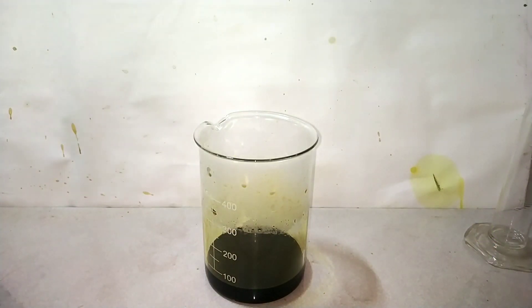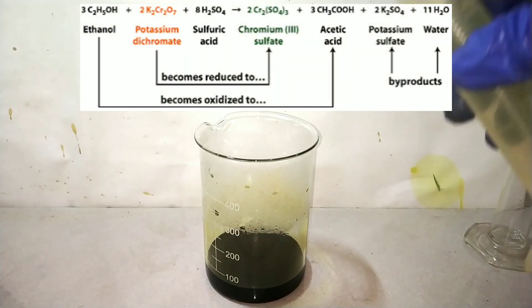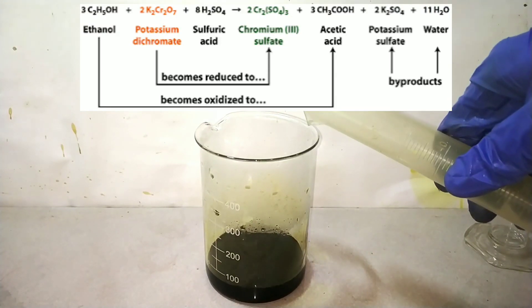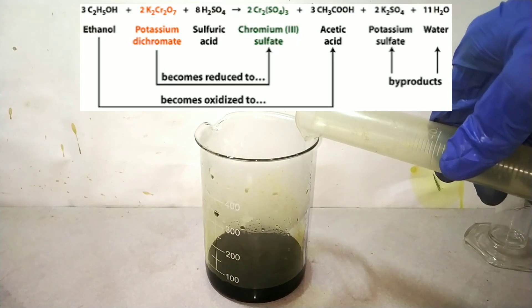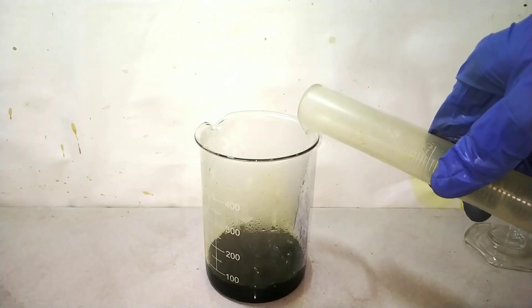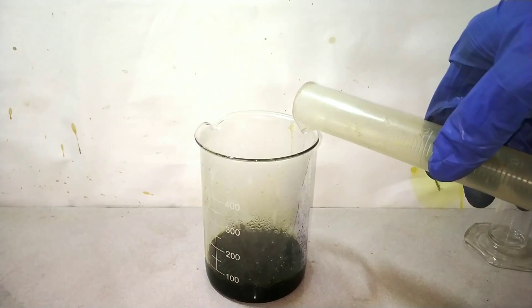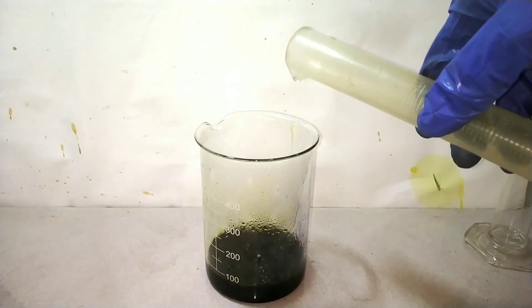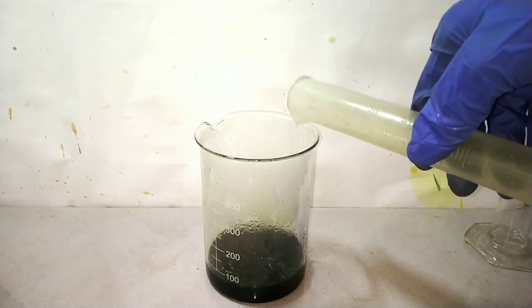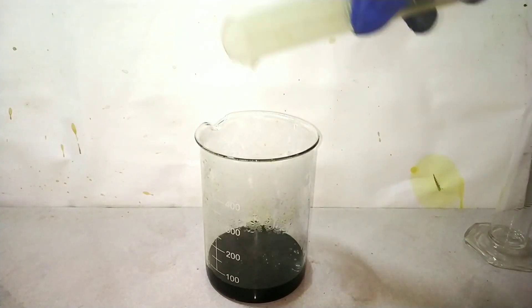What's happening here is a redox reaction. The primary alcohol, ethyl alcohol, is getting oxidized into the carboxylic acid acetic acid, also called ethanoic acid. Ethanol first gets oxidized to ethanal — the aldehyde form — then immediately gets oxidized further to acetic acid. The oxidizing agent is potassium dichromate, which gets reduced to the plus 3 oxidation state, forming chromium sulfate and potassium sulfate. Acetic acid is formed as a byproduct, and your work area will soon have the smell of vinegar.